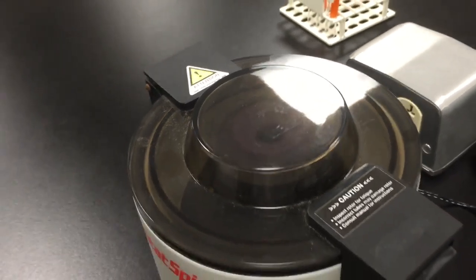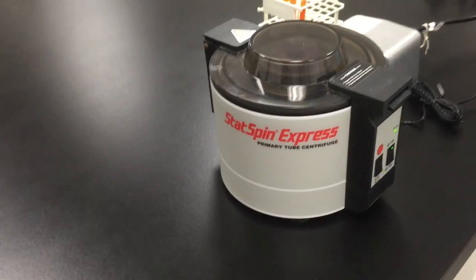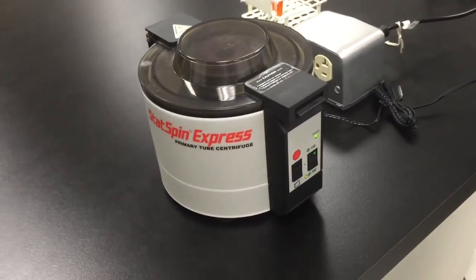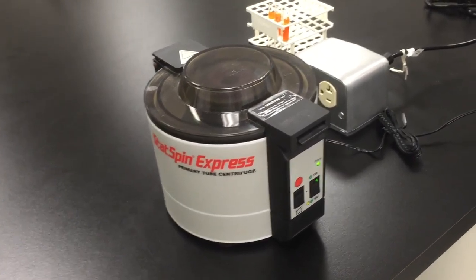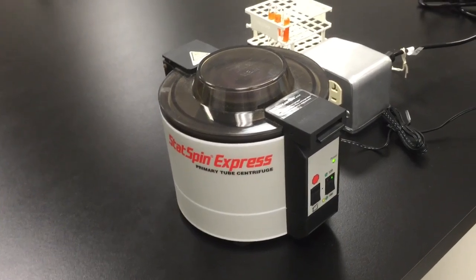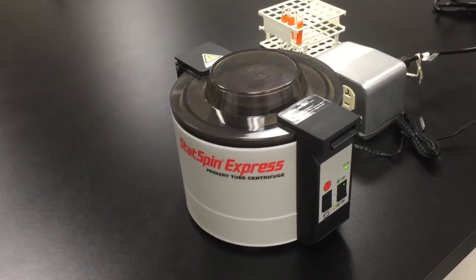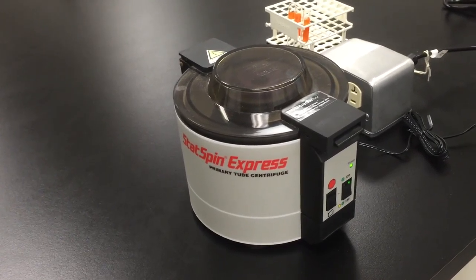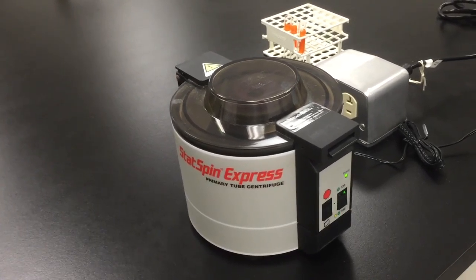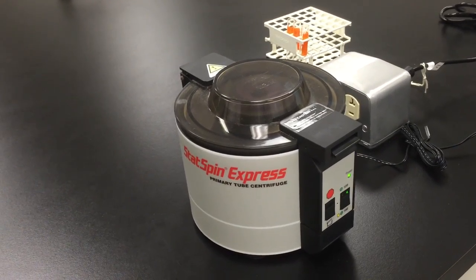Normally, this centrifuge would go for anywhere from 5 to 10 minutes depending on what you are testing for. But for the sake of this video, we are going to just let it run for about 30 seconds and then we will stop the centrifuge operation.